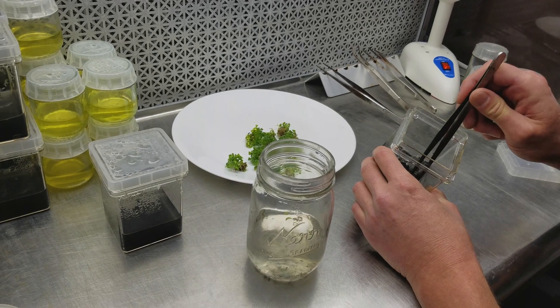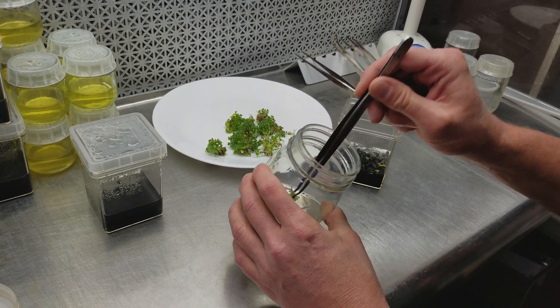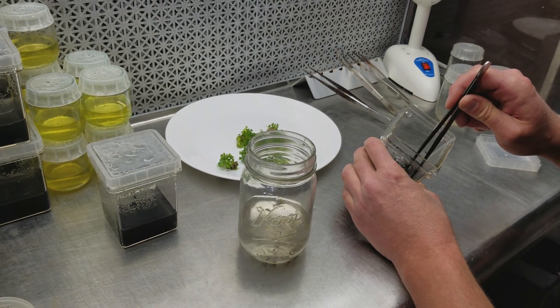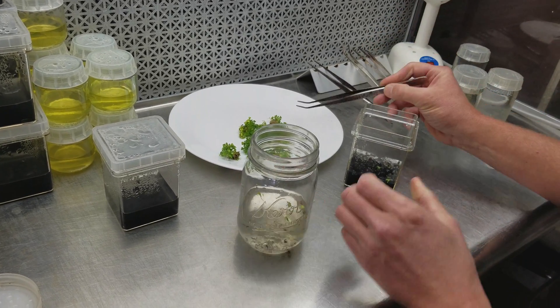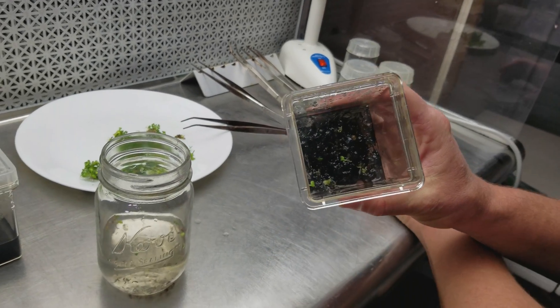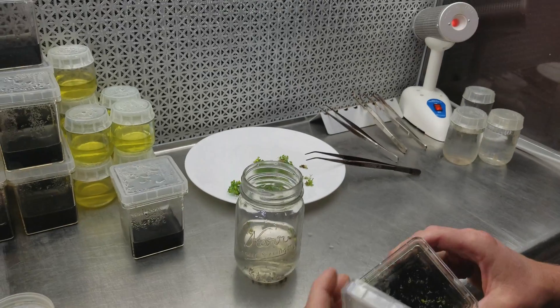I've never tasted them, but I don't think they'd be very good. You could use them like sprouts on a salad or something. No — they're sacred! Okay, that's good enough. I got most of the stuff out of there — you can see there are a couple of tiny little pieces still, but the clumps are gone.